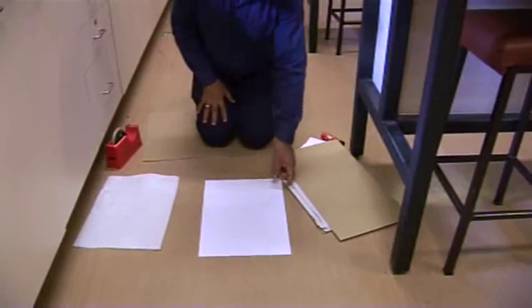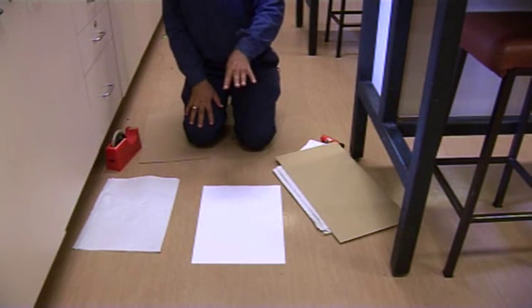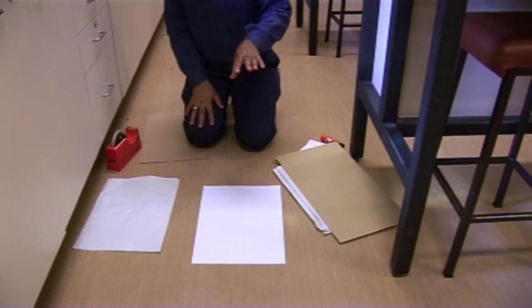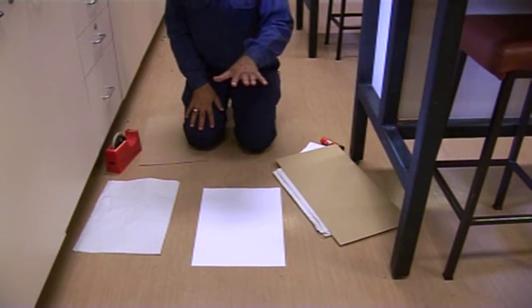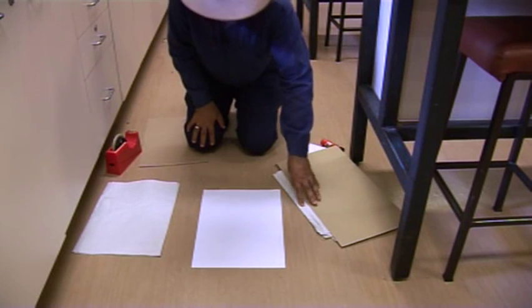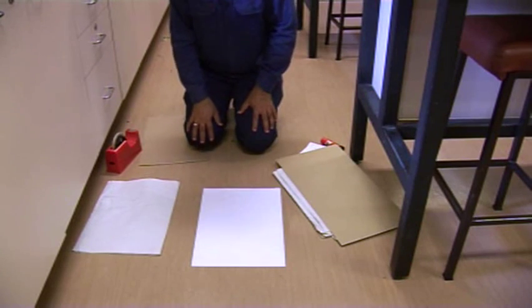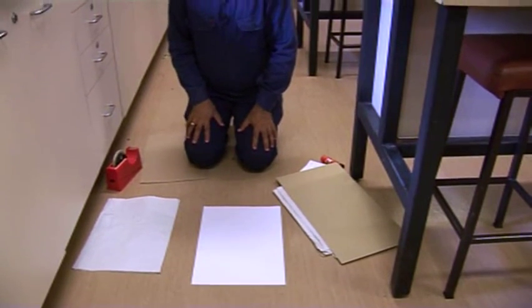This is the A3 size white paper, preferably acid-free paper — reflex paper is usually acid-free. And then you need to transfer those samples after drying onto this, so that will be the record of your collection and that will be kept for hundreds of years.